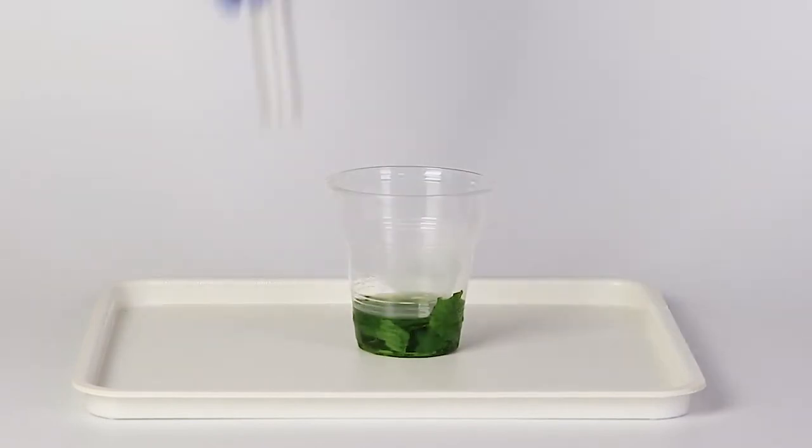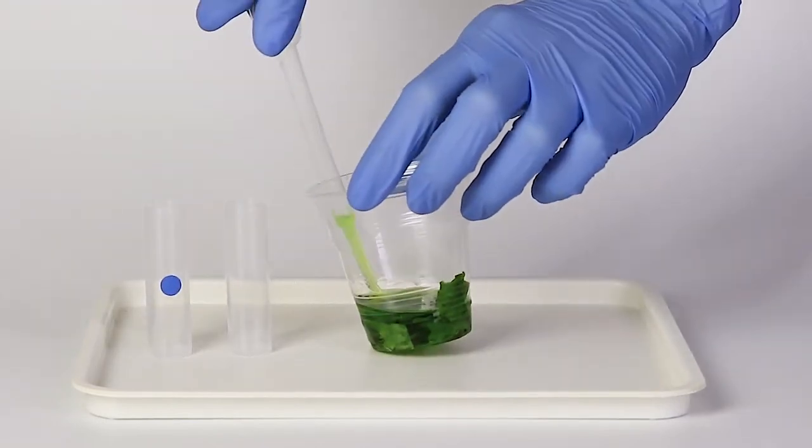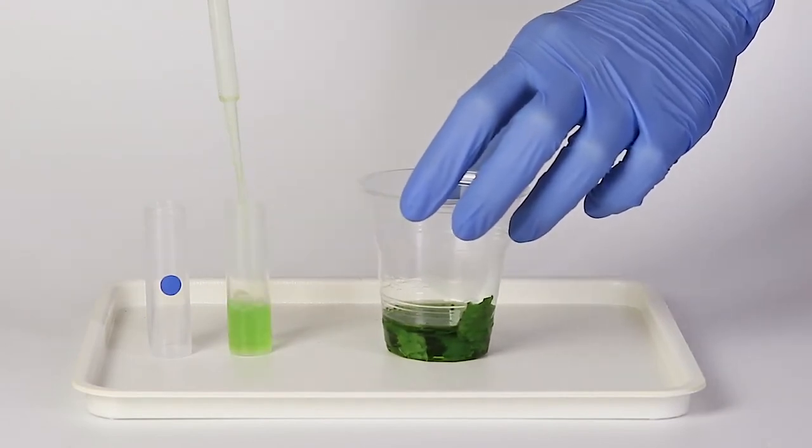Remove the cup from the beaker. Using a pipette, measure 2.5 milliliters of the obtained solution into the vials.